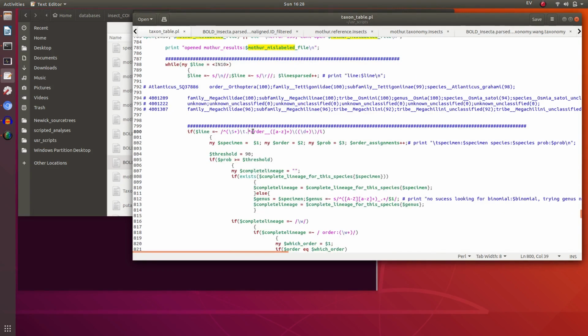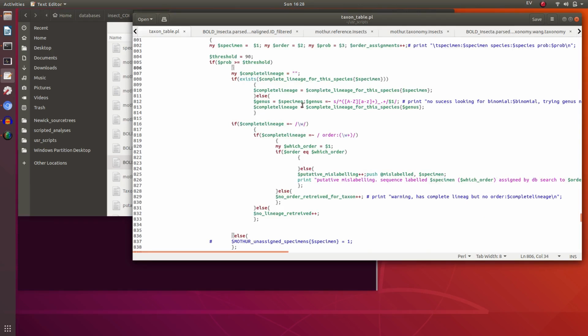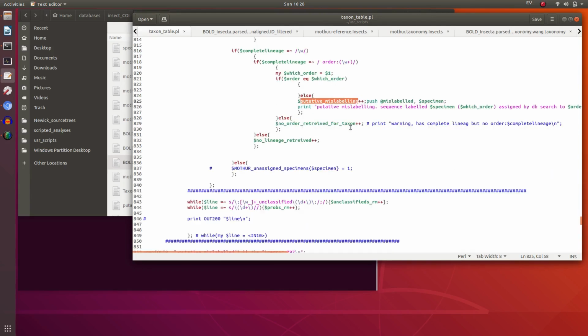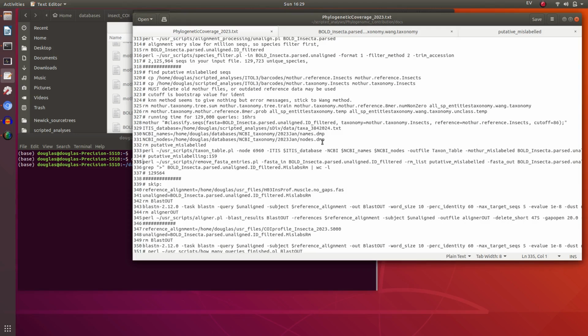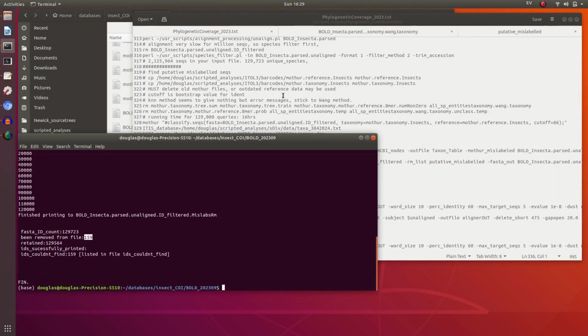Go through that output file and look for lines which have at least an order classification or order assignment. Check the threshold. Check that it's a well supported identification. Take the original lineage, and if the annotation of the sequence is the same as the molecular identification, great, that's fine. Anything that isn't is a putative mislabeling, and these are all printed to this output file here. So we have 159 probably mislabeled sequences, and they just need to be removed. So we'll just remove these FASTA entries using that list. Remove those 159 and we'll go from there.